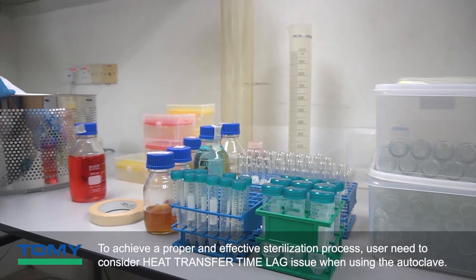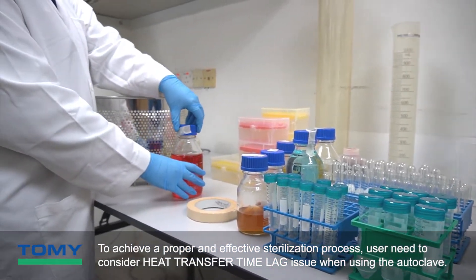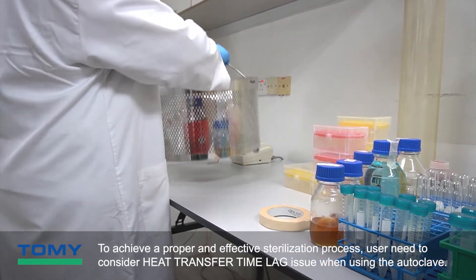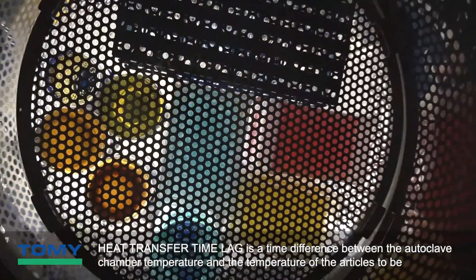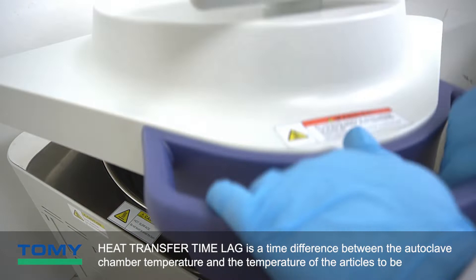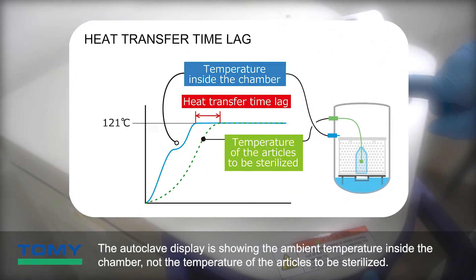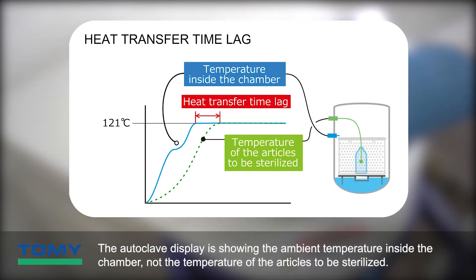To achieve a proper and effective sterilization process, users need to consider the heat transfer time lag issue when using the autoclave. Heat transfer time lag is the time difference between the autoclave chamber temperature and the temperature of the articles to be sterilized. The autoclave display shows the ambient temperature inside the chamber, not the temperature of the articles to be sterilized.